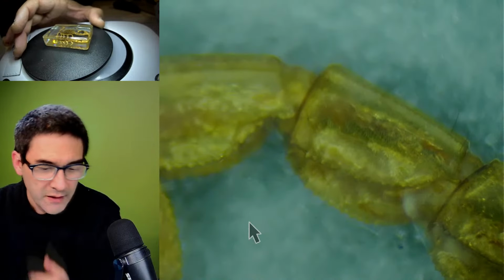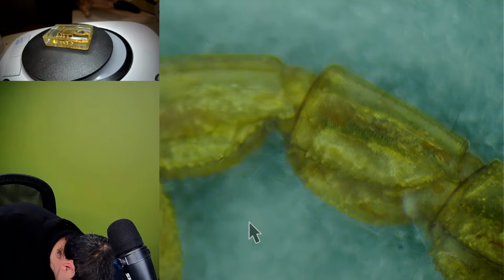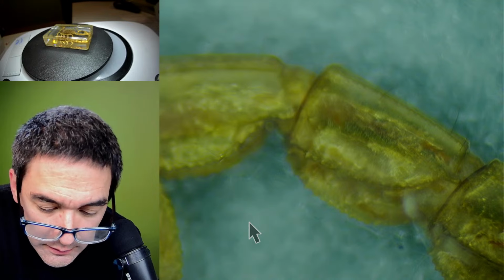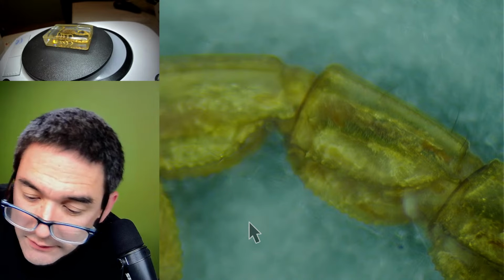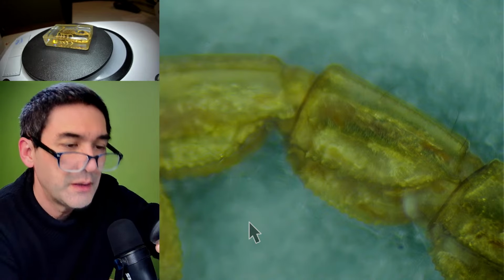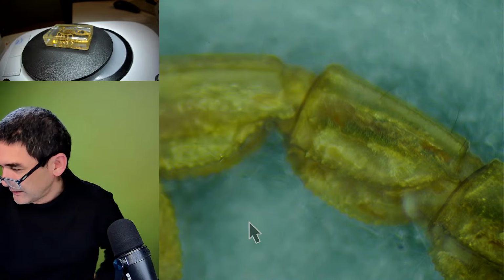I don't know. Do I have just a second? It's another question. Let me see if I have some polarizing filter here. Where did I put them? I've gotta be careful that I don't hurt myself another time. Here, I got some linear polarizing filters. I wonder if this works. I'm just gonna hold it over the specimen. But normally, we're gonna see.